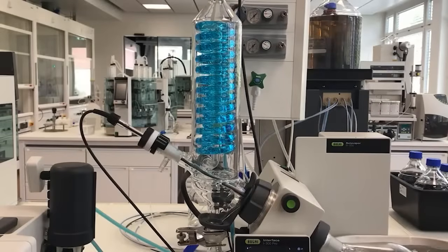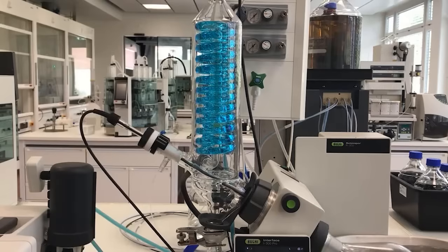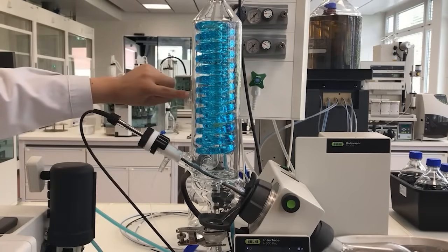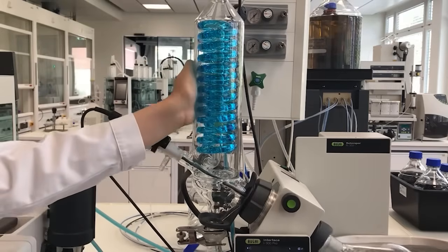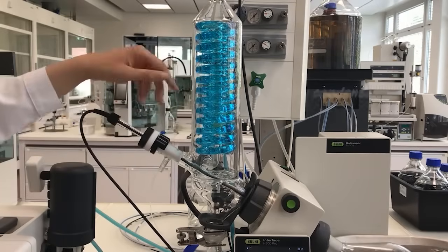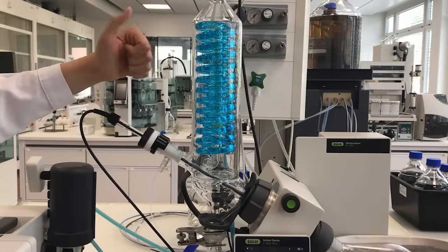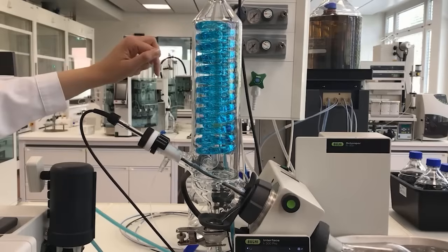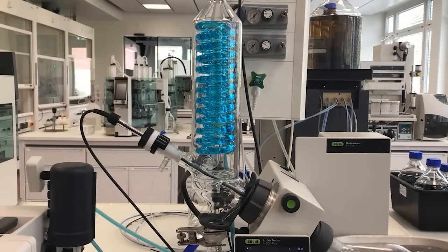The condenser loading is an indication of the distillation rate. You can check the condenser loading by looking at the droplets of solvent on the condenser or by touching it and assessing where it is warmer. The maximum condensation level is at 75% and is shown by a line on the condenser. If it goes above the line, your pressure will need to be increased. If it's lower, then the pressure needs to be decreased.